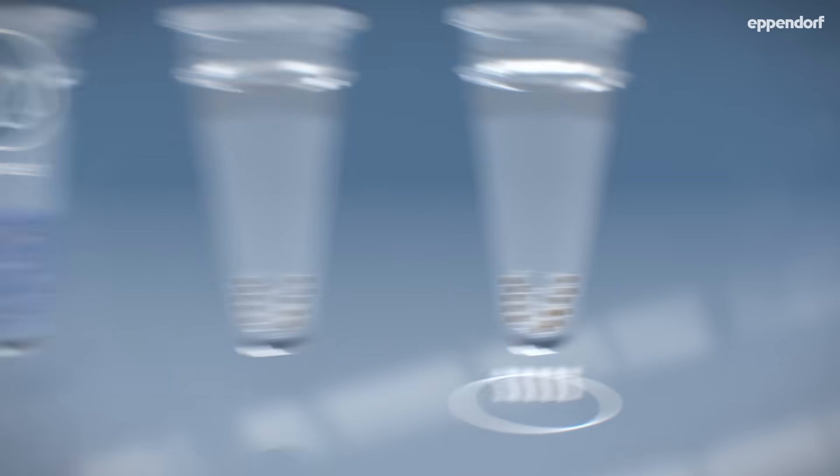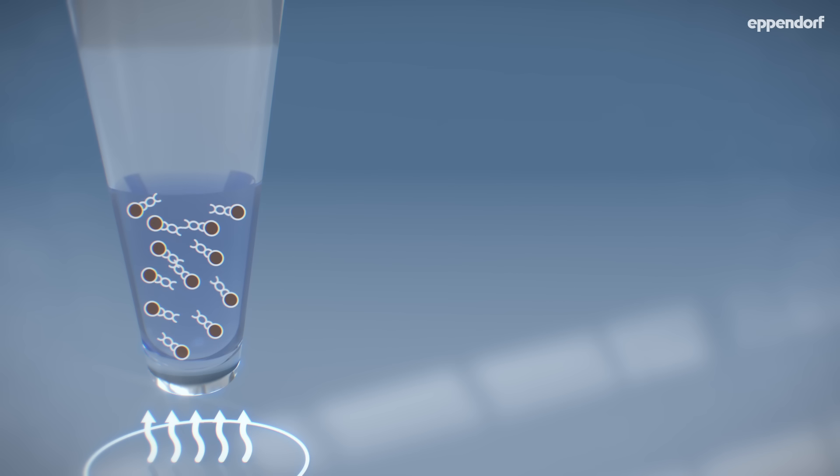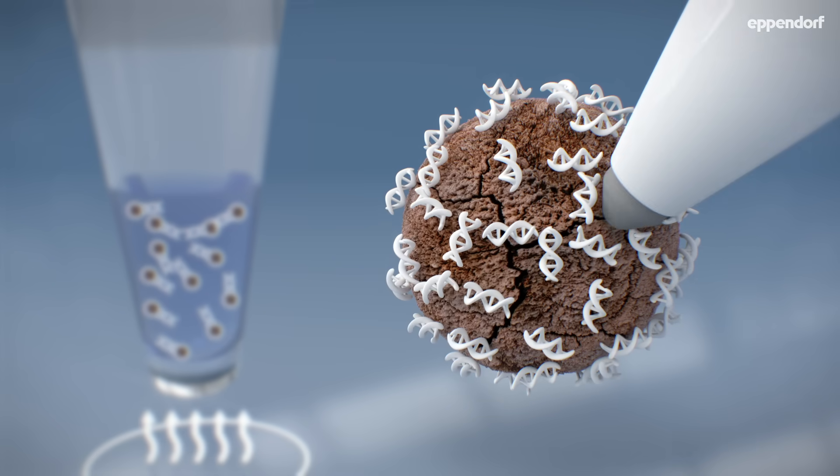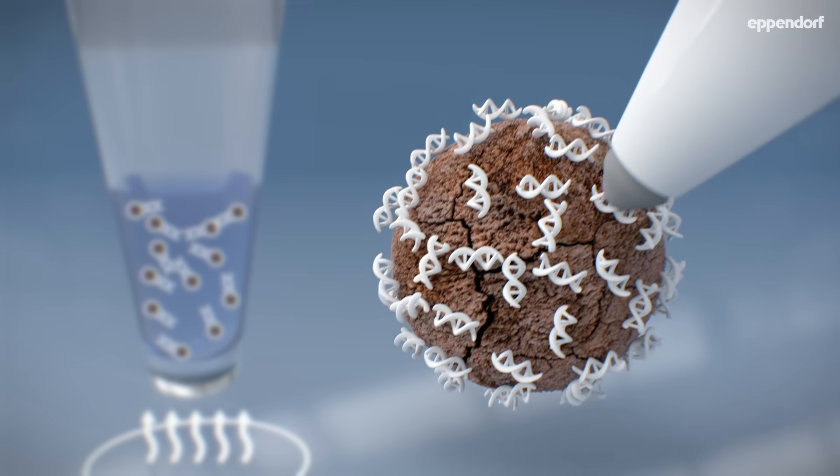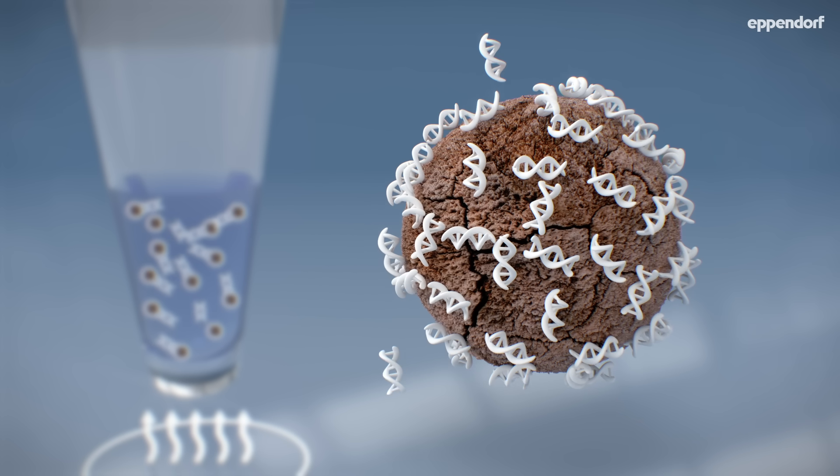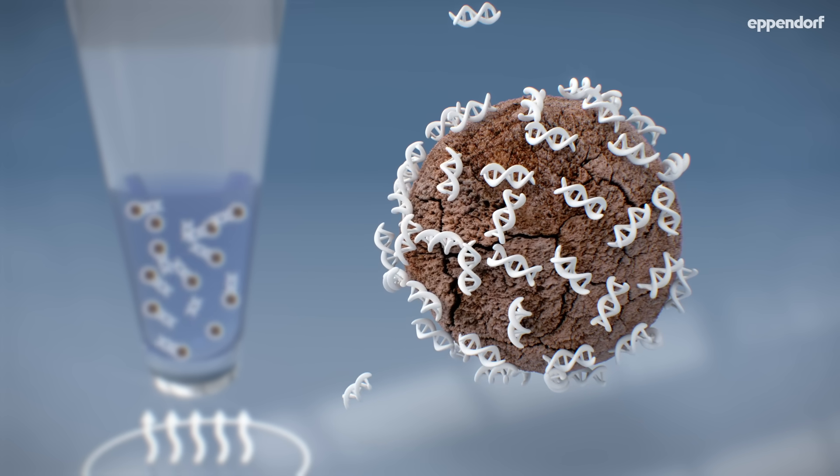Maybe we can get better results if we assist the drying process with heat. Oh no, this pellet has been over-dried. The beads are brittle and it's hard to remove the DNA. This pellet was too dry.